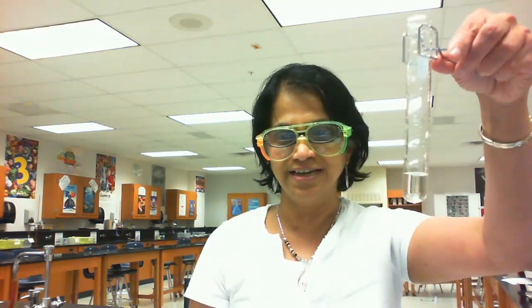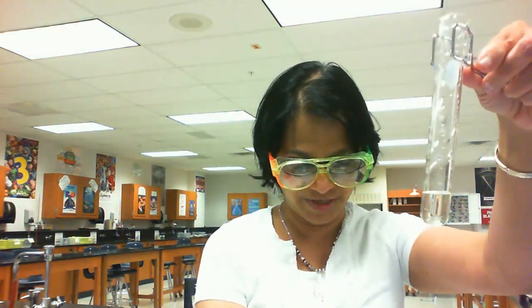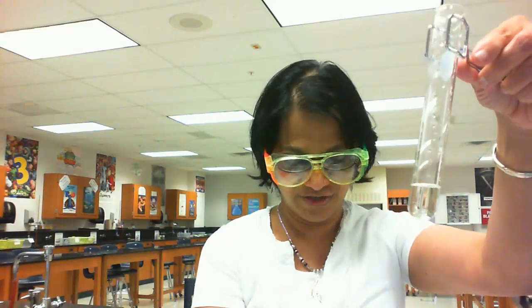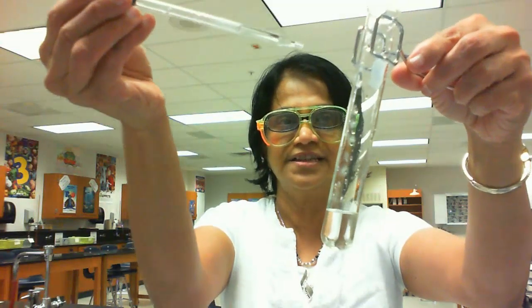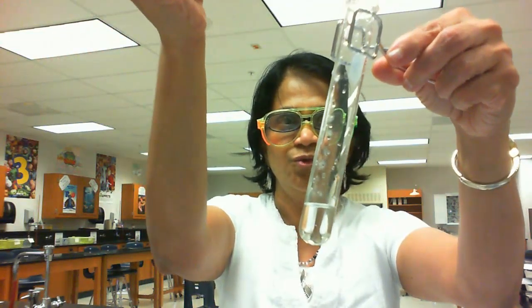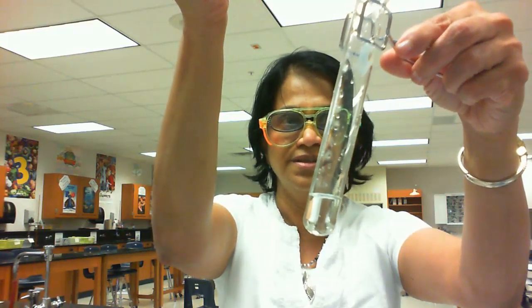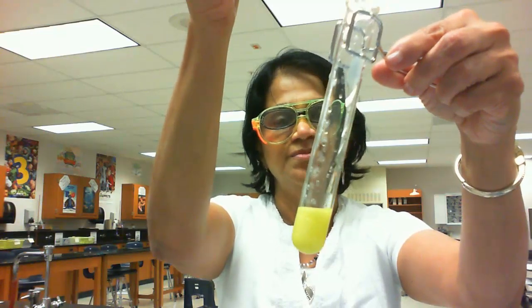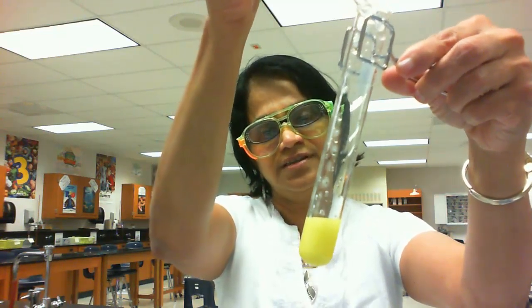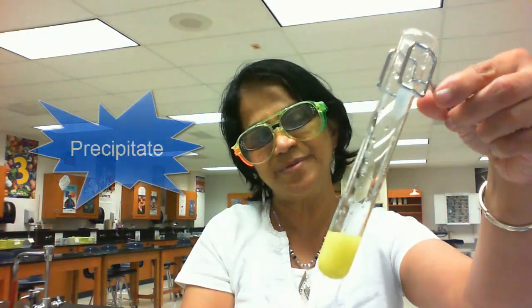So here what I did, in this test tube I already have some potassium iodide solution. To that I am going to add this lead nitrate solution, which is also a colorless solution, and here goes the first drop, and look what happened. It ended up giving you a thick yellow solid. We call this a precipitate.